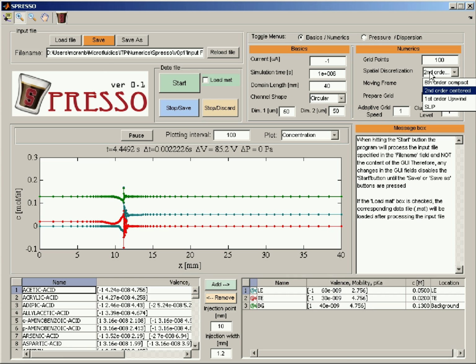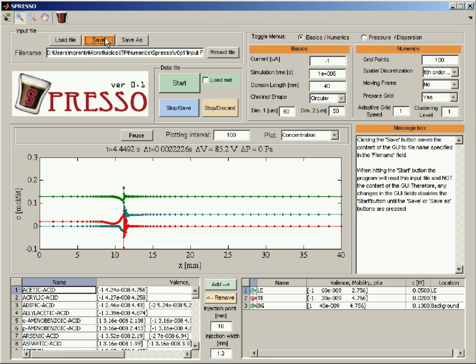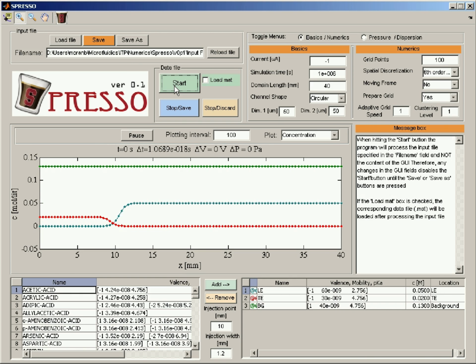centered scheme. Let's switch to the sixth order compact scheme. This is a much higher resolution scheme. And this should be able to resolve this problem. So again, I'm saving it and starting again. It starts the same way. The adaptive grid clusters the grid points. And now electromigration begins. And in this case, I hope it will be stable. Okay, so as you can see, you get a rather sharp gradient, but there are no oscillations, and the interface is moving downstream.